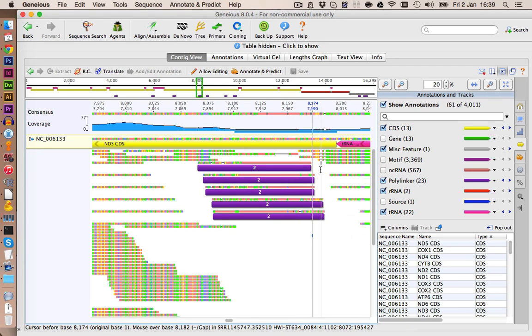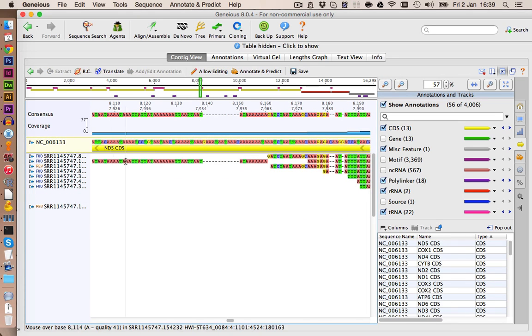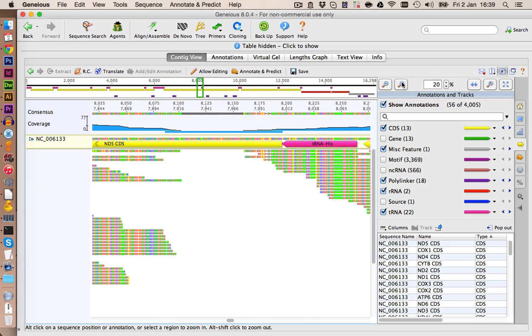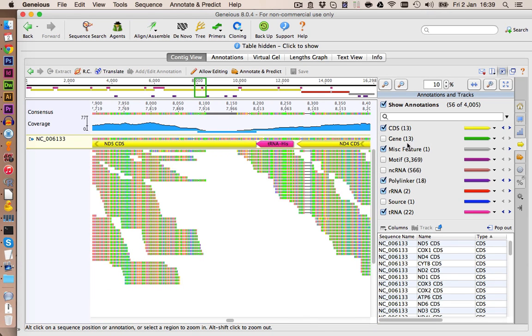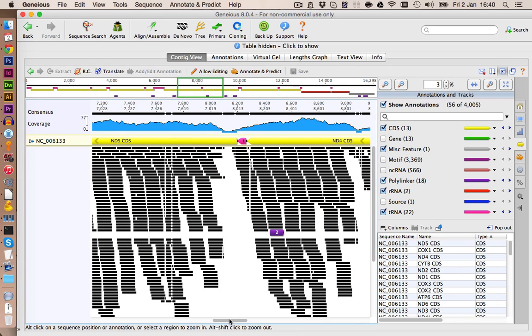However, this doesn't look really good, so I think we should delete these sequences again. This is a lot of A's, and this doesn't make sense because this region here is gene coding. So we're going to delete these sequences here. I'm also going to try and delete maybe this sequence here, as it might be preventing other, maybe correct, hits from being mapped. Let's click on save again. And let's see if we find any more additional hits.